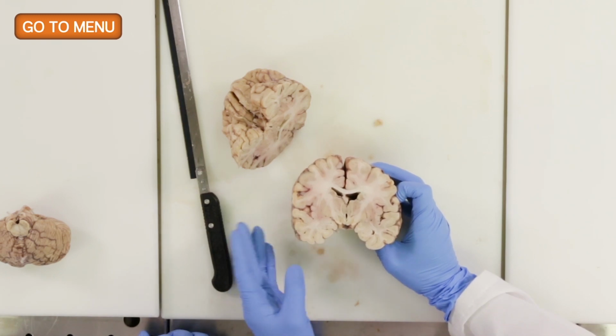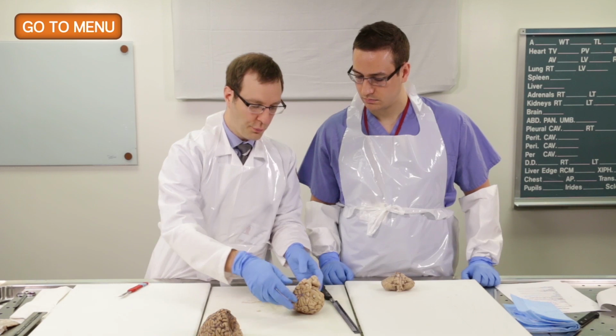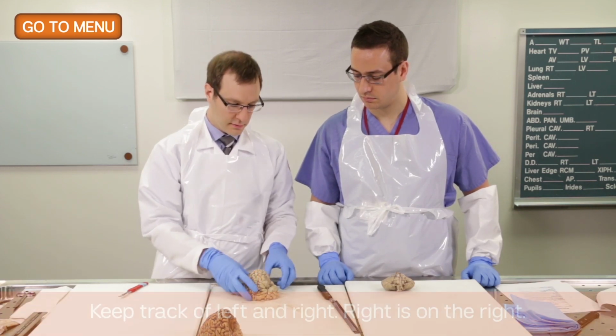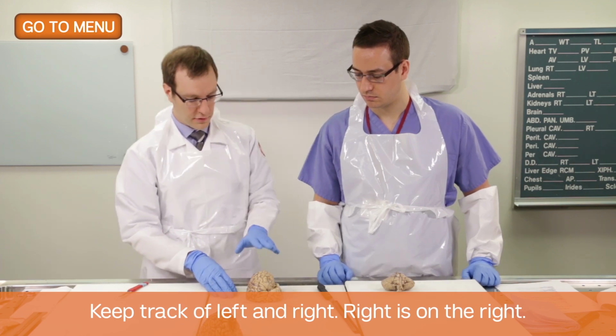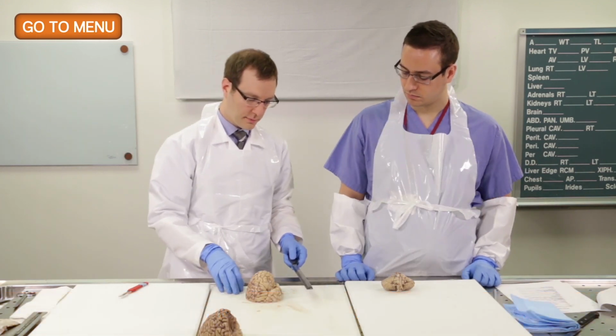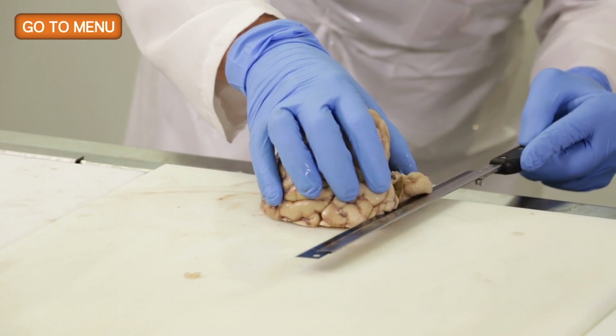So now we'll cut in turn each half of the brain, and of critical importance here is to keep track of the right and the left aspects of the brain. So first we'll cut the anterior half of the brain, and then we'll cut the posterior half. So now we'll proceed to make our coronal cuts.